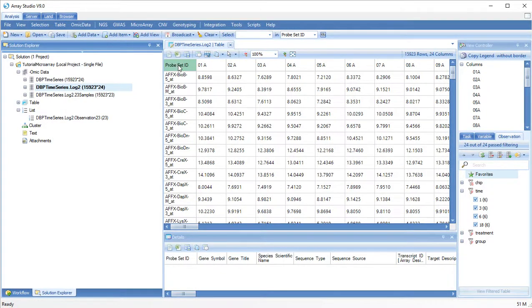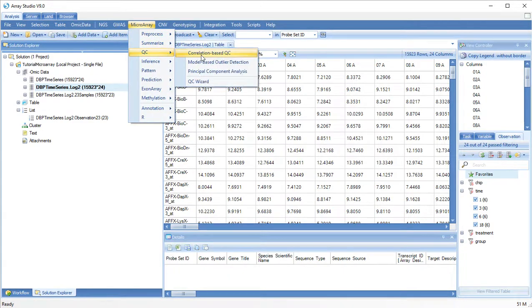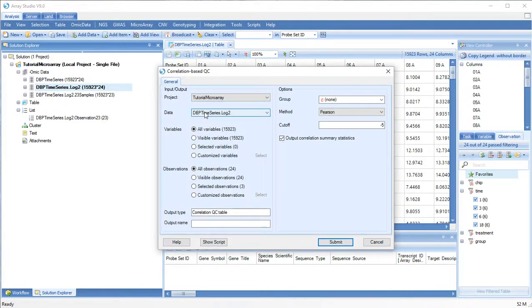Another way to run QC on your omic data object is correlation-based quality control. Choose your source data, which variables and observations to test. Name an output, and a cutoff.